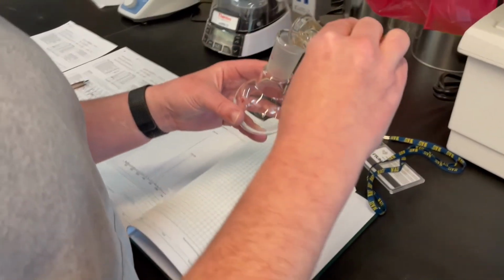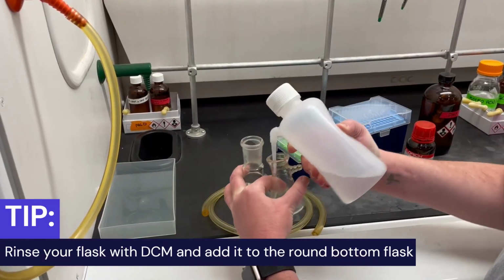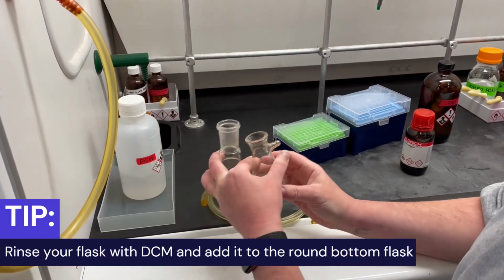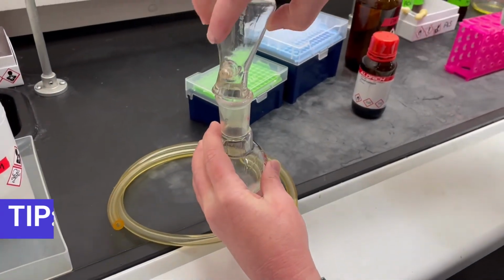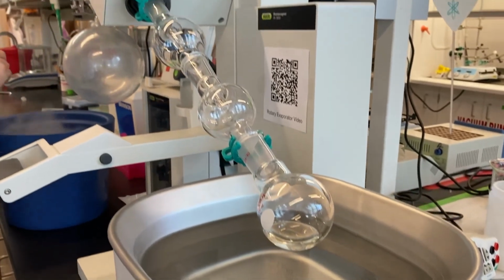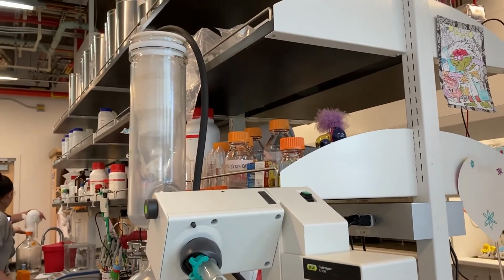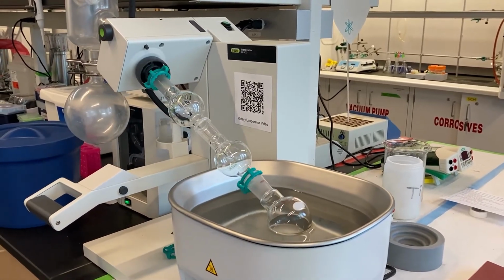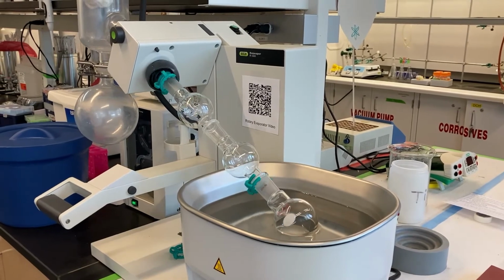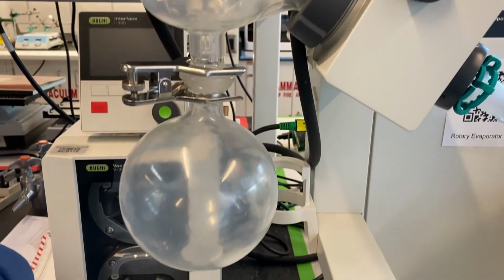Transfer your peptide solution into a round bottom flask and rotovap off as much of the TFA as possible. Refer to our video on how to use the rotovap for more guidance on operating this instrument. TFA has a very low boiling point, and the majority will evaporate off quickly, but some will still remain. Because TFA is such a strong acid and can cause degradation to our peptide over time, we will need to perform an ether precipitation to fully remove the TFA from our peptide.